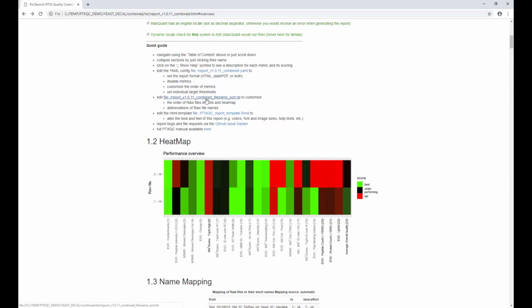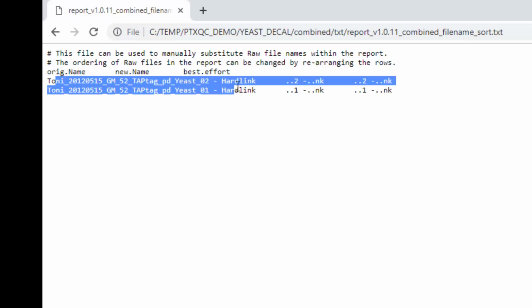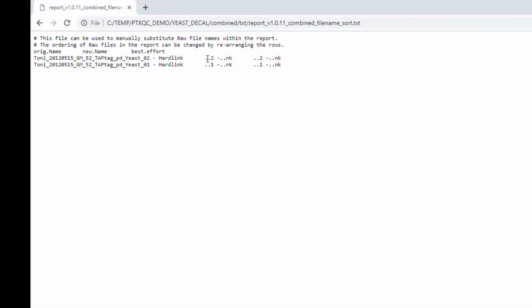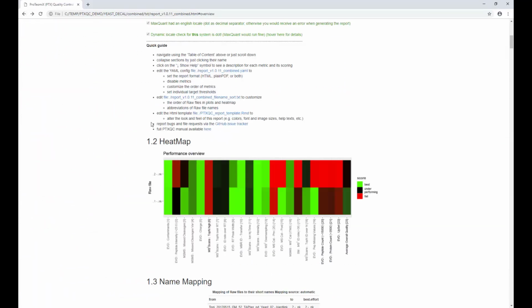We have a file name sorting txt, which is also right next to the report. So this is basically the attempt of PTXQC to make raw file names in the plots more readable, because those names can get pretty long, which means the axis labels are also going to get pretty long. So what PTXQC is doing, it's going to find common substrings in those names and remove them. So this is basically the subtext that remains, and those are the raw file names which PTXQC came up with, and this is what it's going to use. If you're not happy with those, you can just edit the text file and use whatever name you like. Getting back to the report, you could even, if you wanted to, edit the markdown template for this HTML report and customize the hell out of it, but we're not going to go there for now.